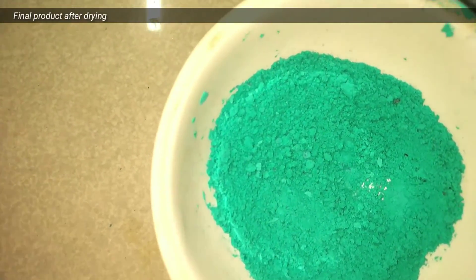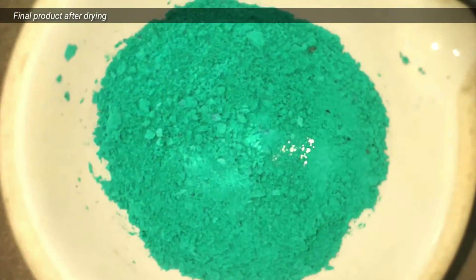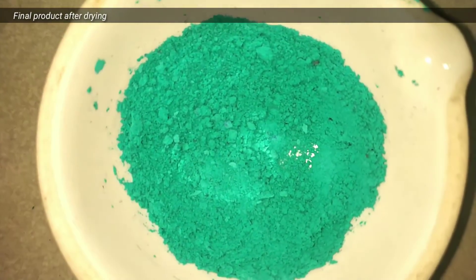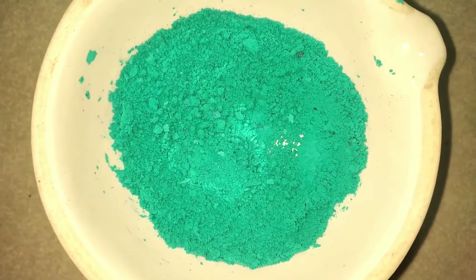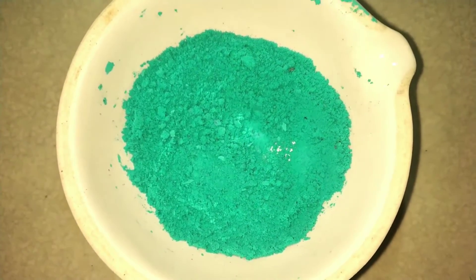And finally we have the dry product here, and this is the hydrated form of copper 2 citrate. You can make it out by seeing the greenish tinge to the compound.